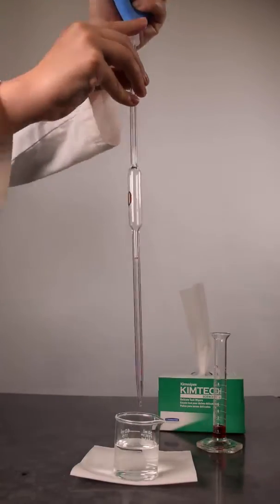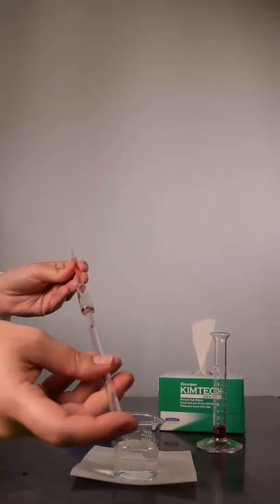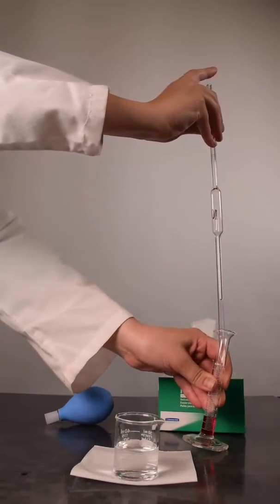Repeat this 2 more times to completely clean a pipette. See the aliquot video for more details on how to rinse a pipette.